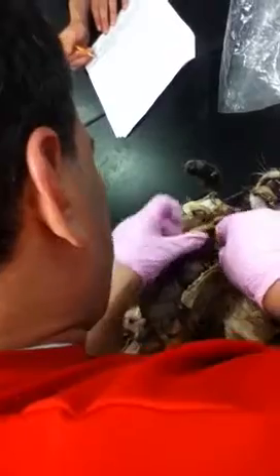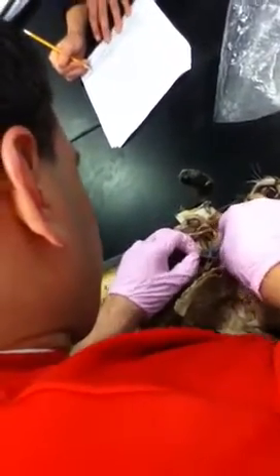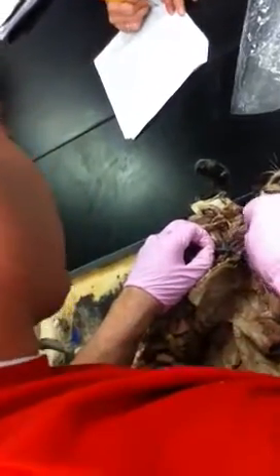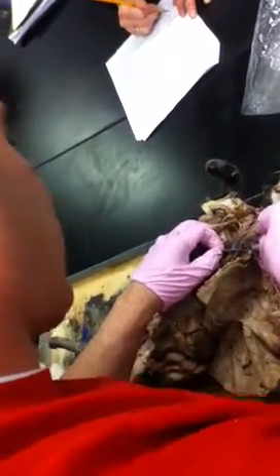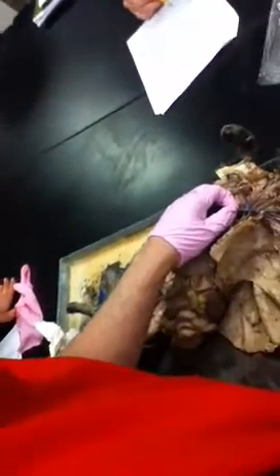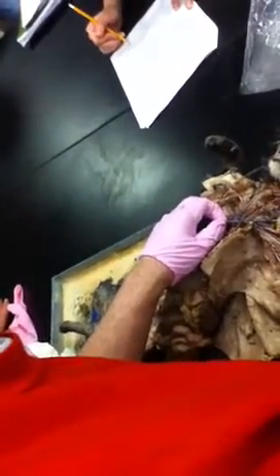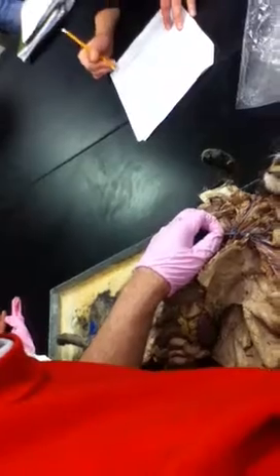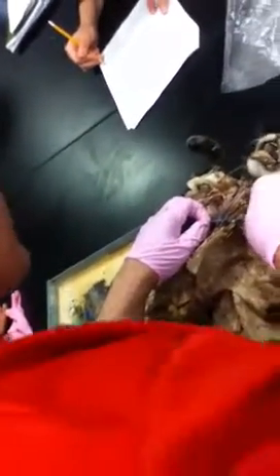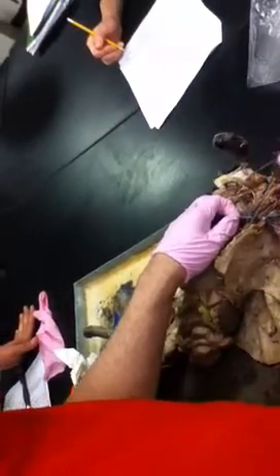So what were those 3 branches coming off of the brachiocephalic? The right subclavian, right common carotid, left common carotid. So 1, 2, and 3. Those are the 3 things you need to know on that, right? External and internal carotids would be a picture. I'd have to tag them real up top here. I probably won't. So, again, brachiocephalic, 3 branches: subclavian, right and left common carotid.